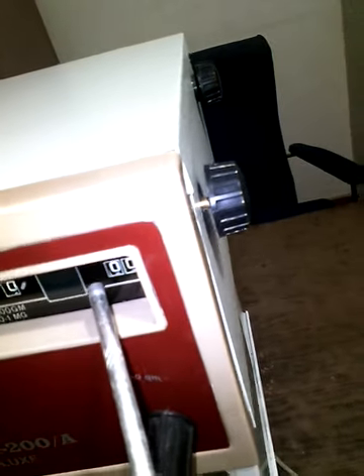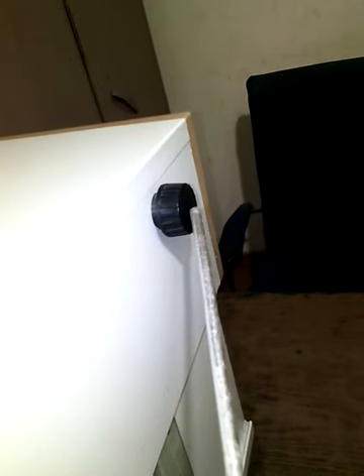At the right side, we have two different types of knobs at the posterior and the anterior side. At the front side, this knob is called a digital knob or micrometer knob, which is mainly used for adjusting the reading at the third and fourth decimal places. At the back side, this knob is called the fine zero adjustment knob, which is mainly used for fine adjustment of zero reading.